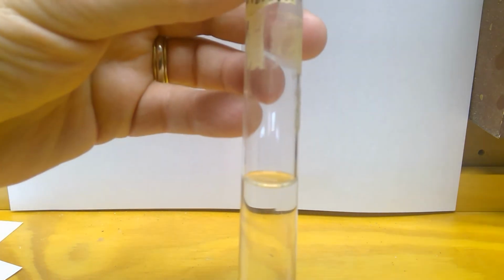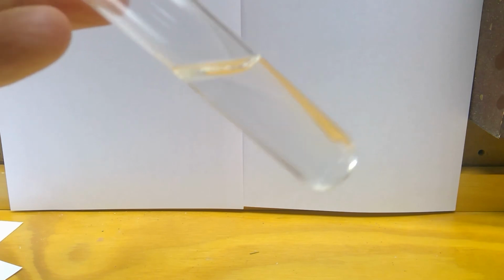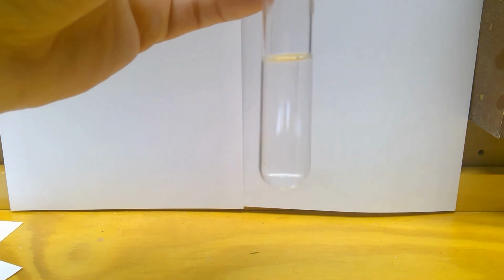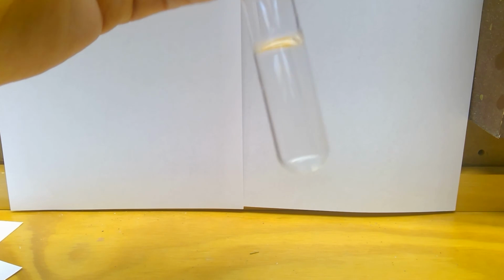And this is them mixed. That should fill in all your boxes.